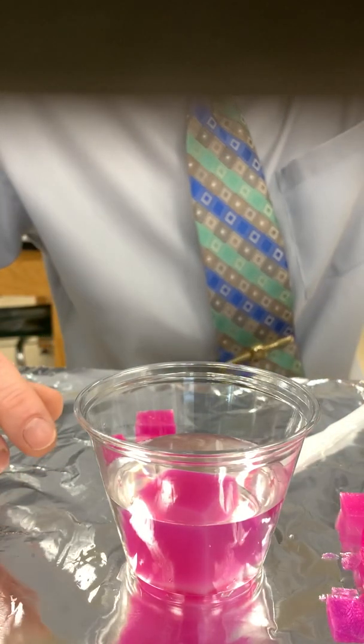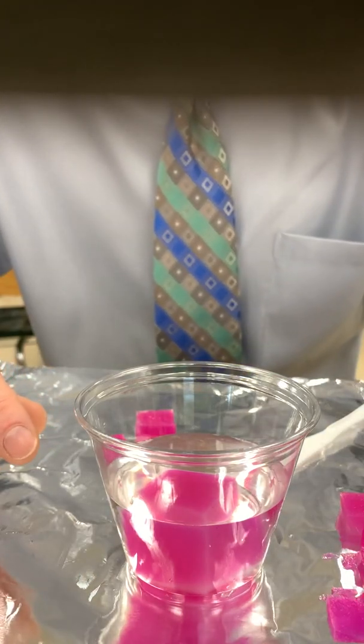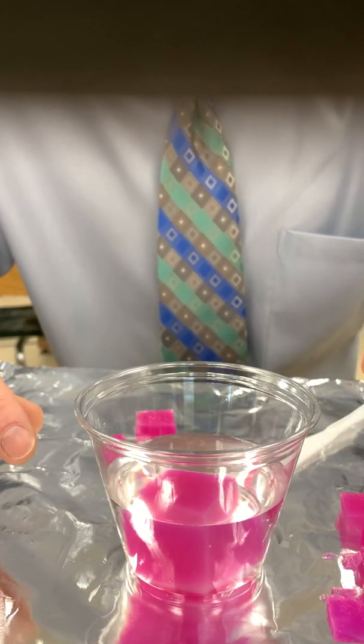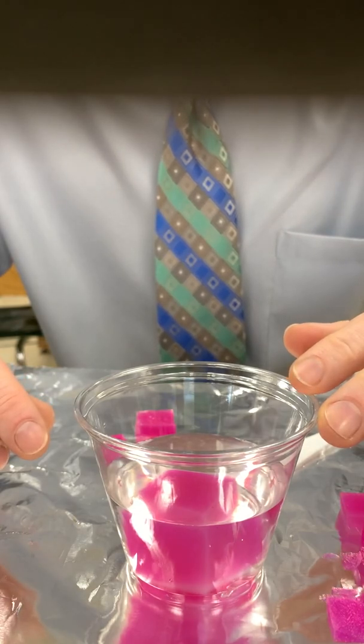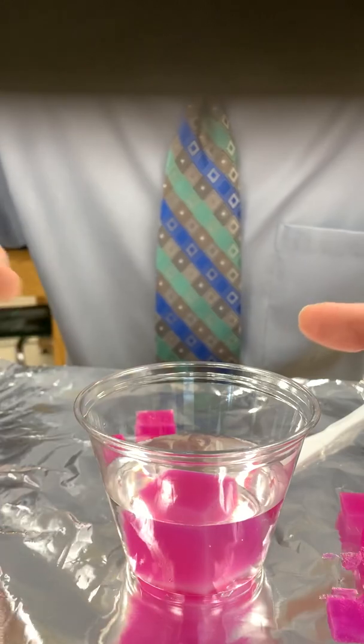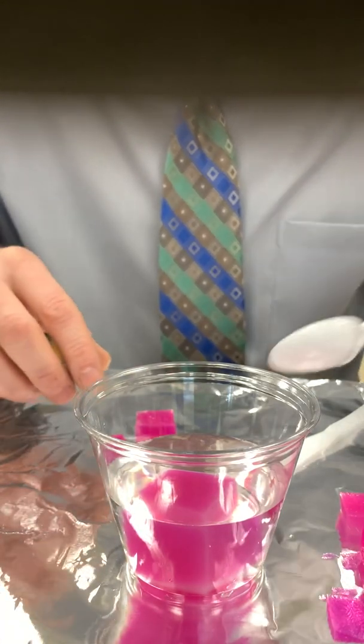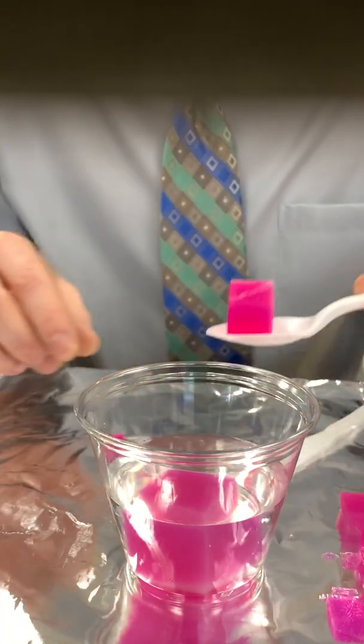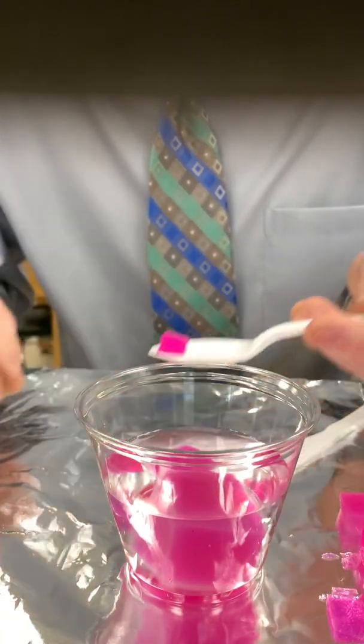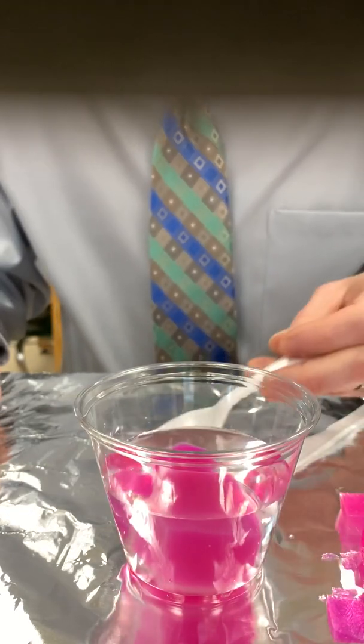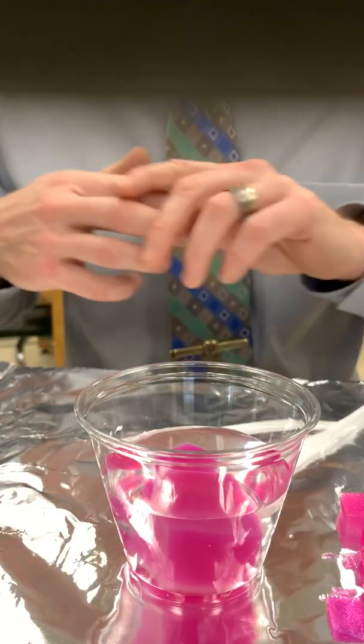We're going to give this one a head start. That's about a minute. Because I know what I'm supposed to do, I'm going to expedite this. We're going to put in our 2x2, and we'll add our 1x1. All three are in there now.